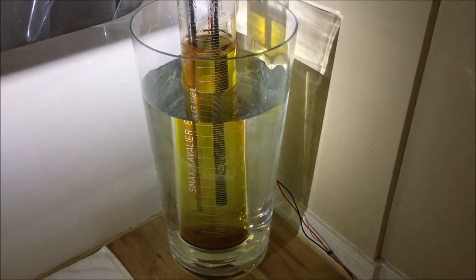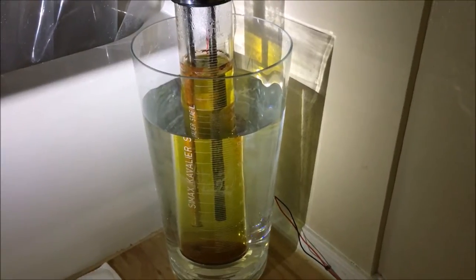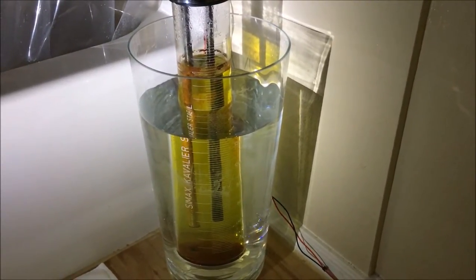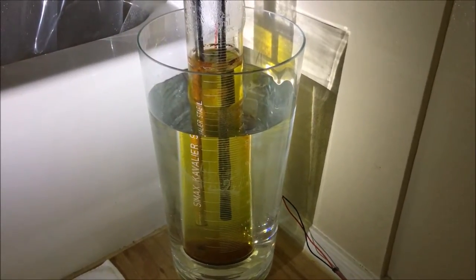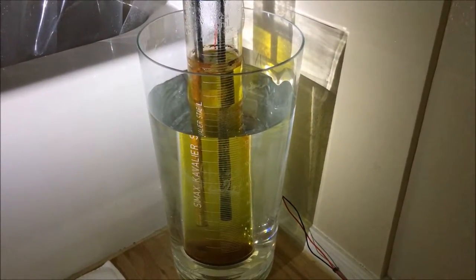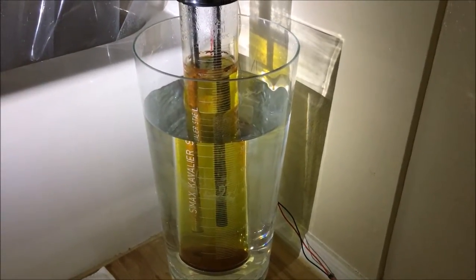Now, as you can see, this project was kind of a failure ultimately, but it wasn't a complete failure because I did learn quite a few things about electrolysis. Interestingly, for about the first 4 or 5 days, this electrolysis went perfectly. The water stayed crystal clear.